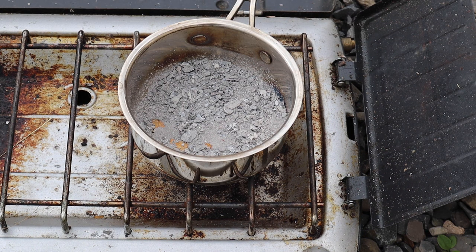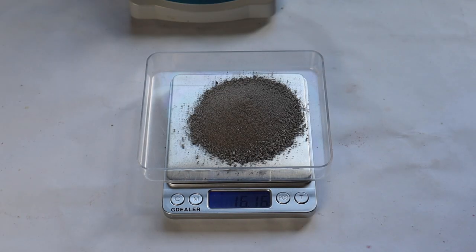What's left should be mostly calcium carbonate. We have about 16 grams of the impure calcium carbonate.